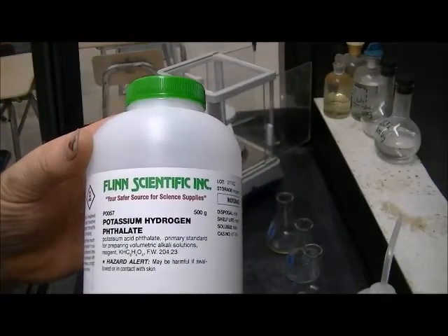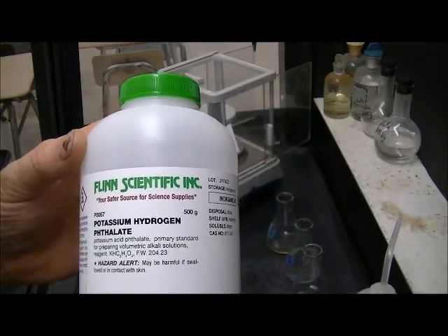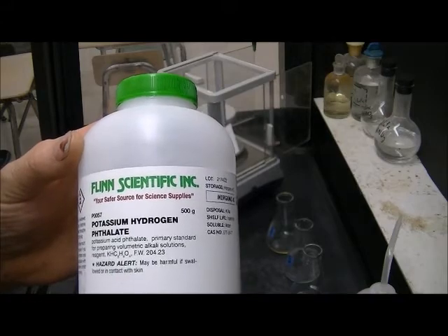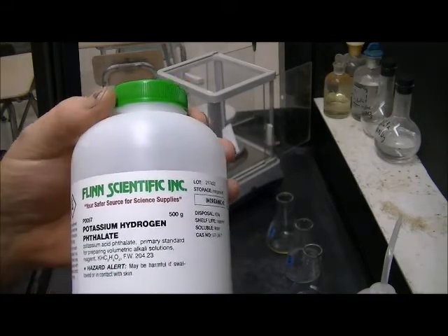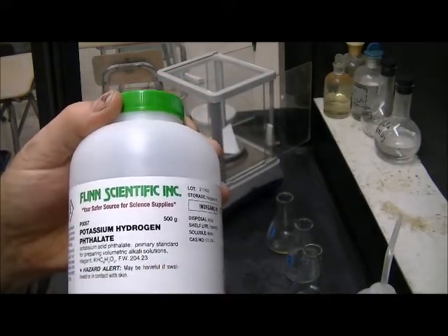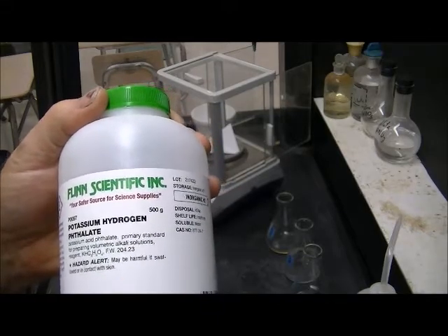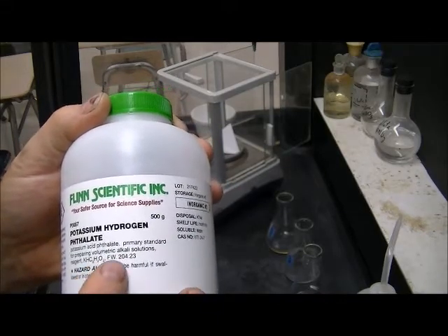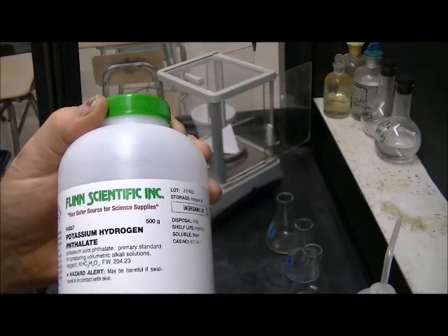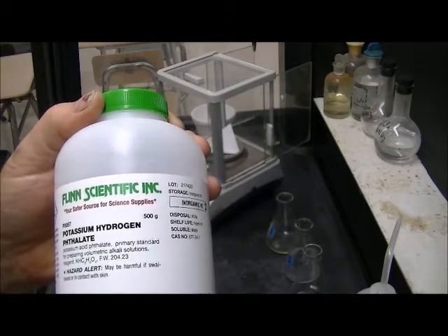This is potassium hydrogen phthalate. It is a chemical known to be very stable and it is a primary standard for preparing volumetric alkali solutions. Its formula weight is 204.23 grams per mole.